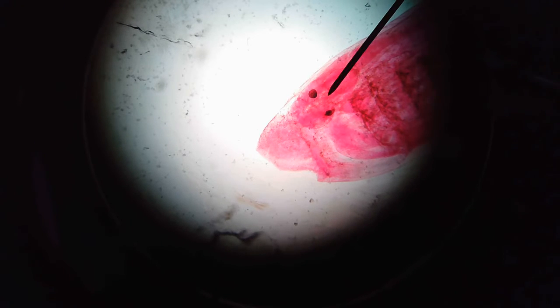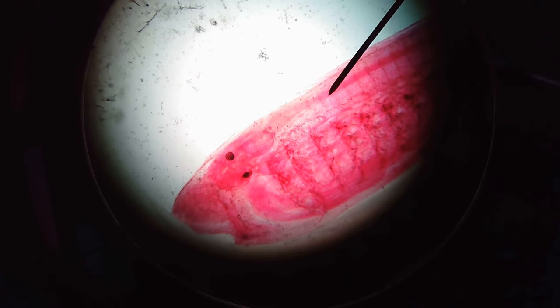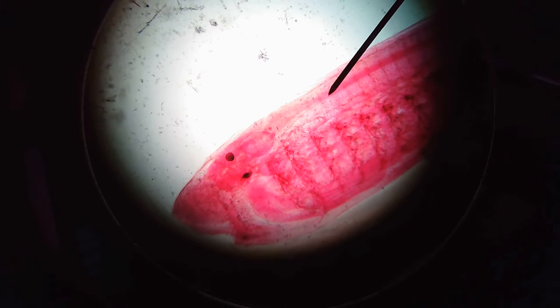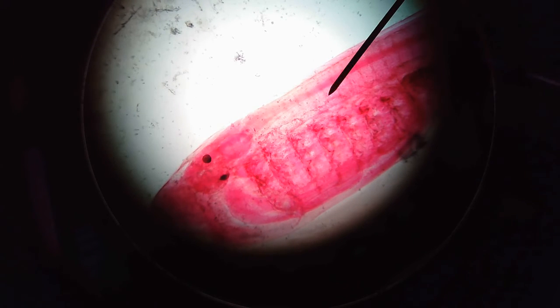So the top one here is the forebrain, and then behind it is the midbrain, and behind that is the hindbrain. And what connects to the brain would be our spinal cord, which would be right on that needle tip there. The spinal cord is also known as the dorsal hollow nerve cord, and right underneath that, where that needle tip is, that almost translucent white area underneath the spinal cord would be the notochord.